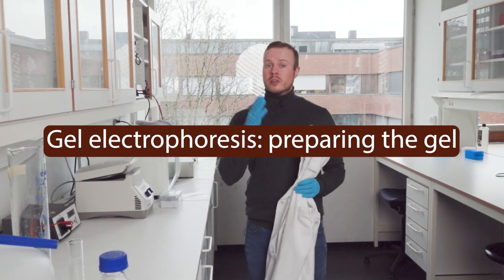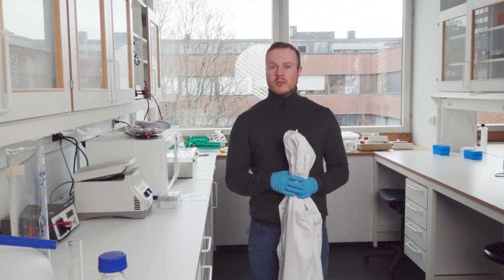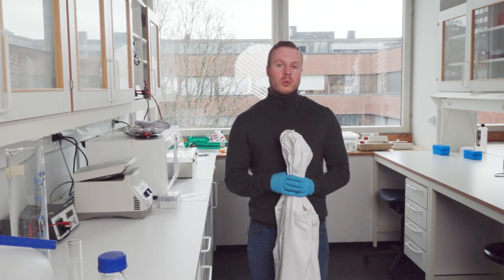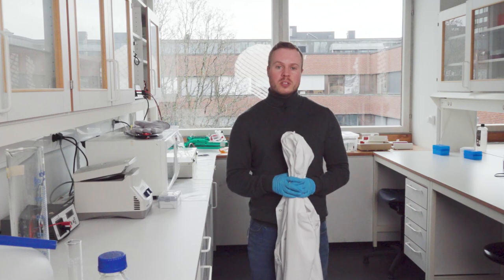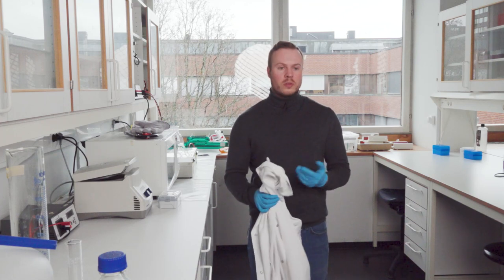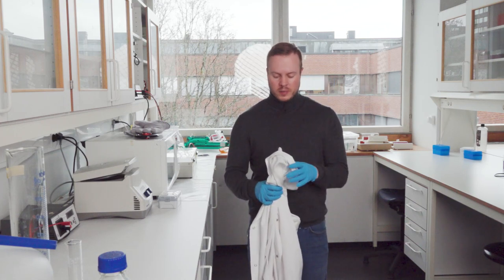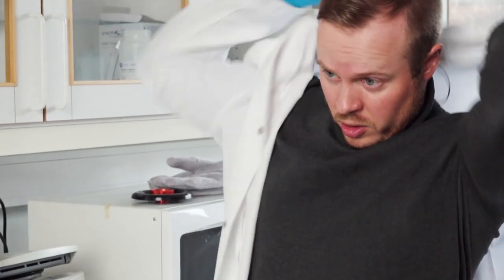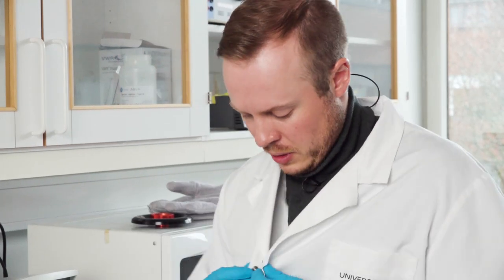We've just started the PCR machine and moved to the post-PCR lab. Something very important when moving into this area is putting on new gloves, which I've already done, and also a new lab coat designated to this area. It's extremely important when talking about contamination risk that nothing from the post-PCR lab moves into the pre-PCR labs.